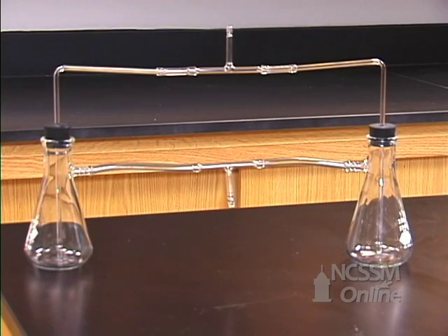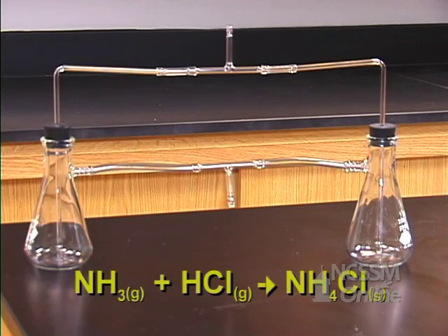We're going to look at an acid-base reaction between HCl gas and ammonia gas. There's still a transfer of a hydrogen ion from the acid, HCl, to the base, ammonia.